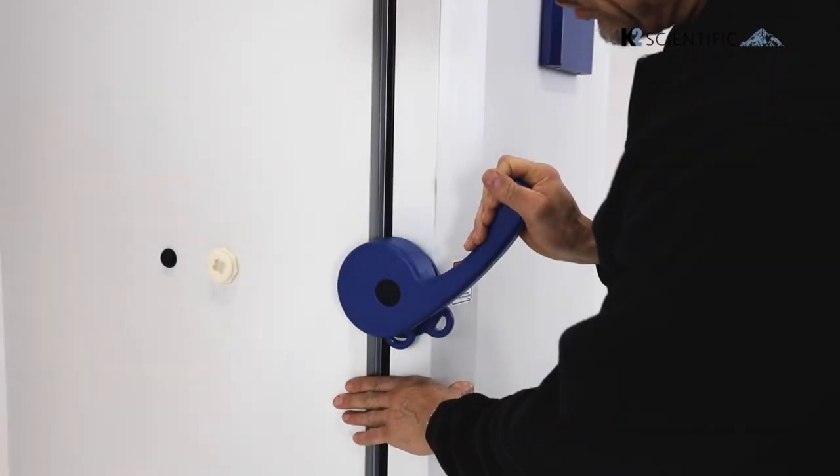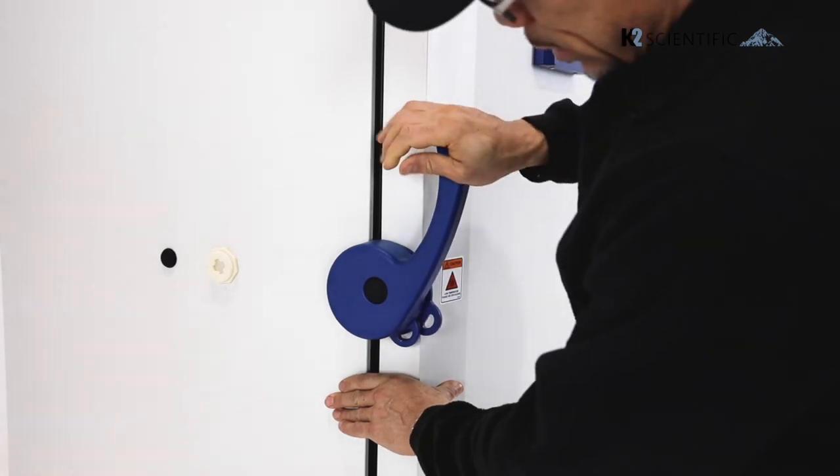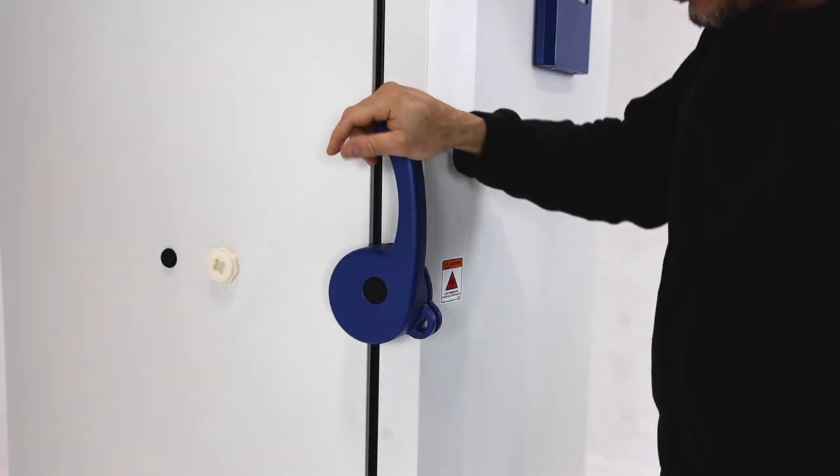When you're closing the K221ULT, you want to listen for the click. That lets you know that the door is securely closed.